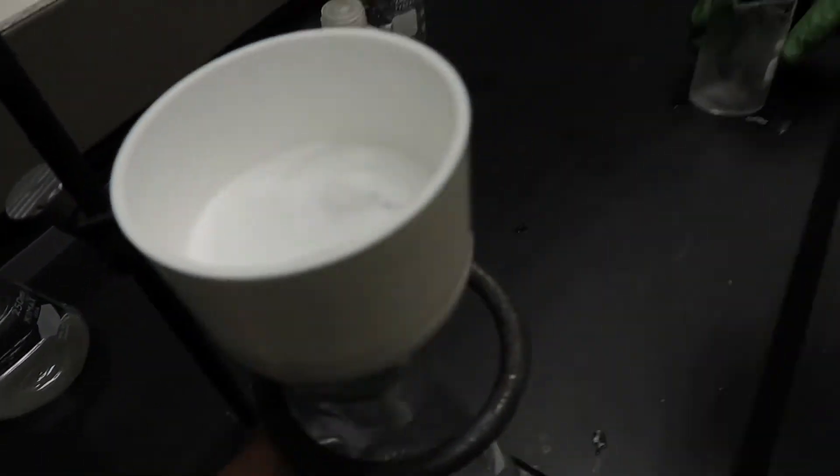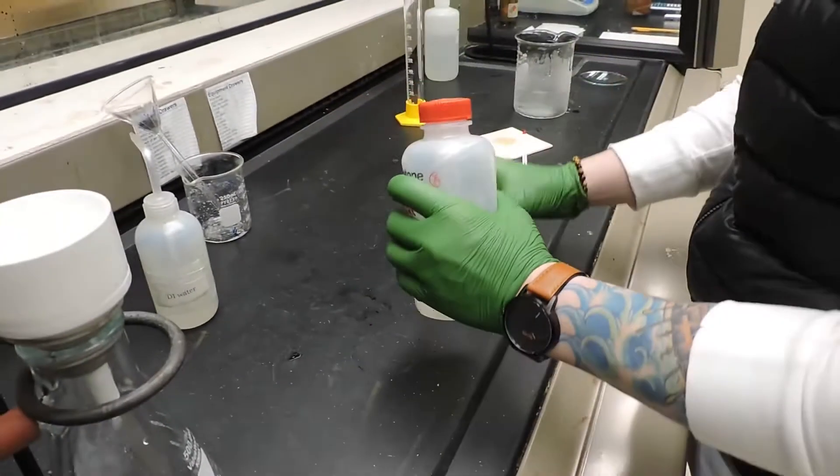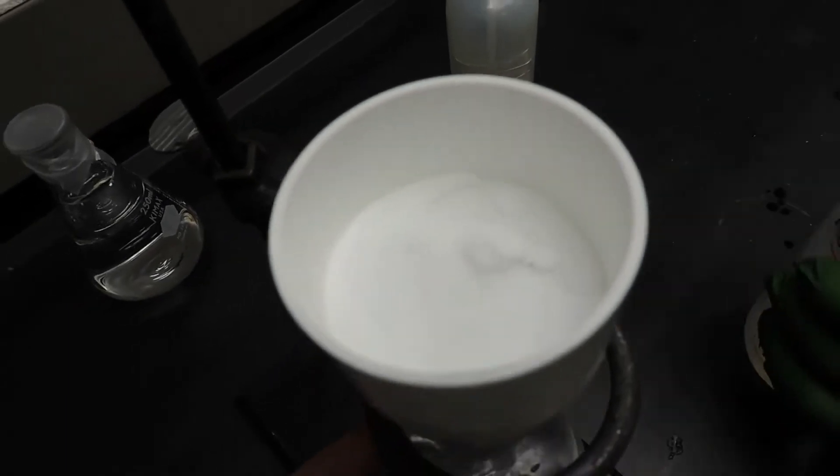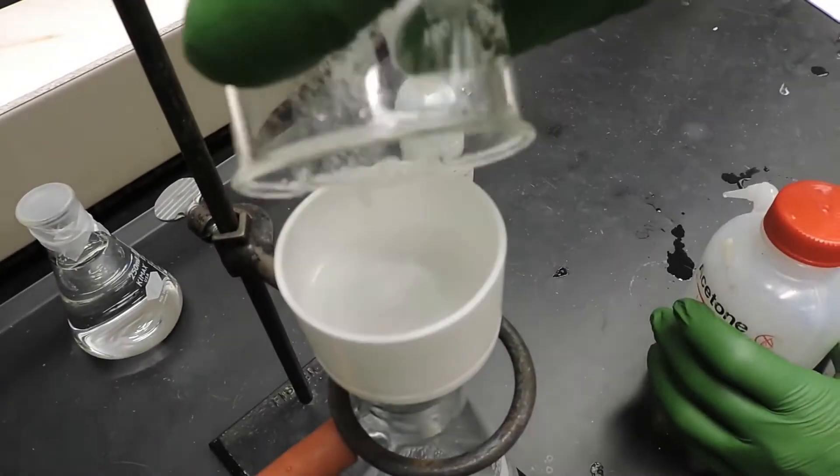Now we can rinse our crystals with acetone because we want to remove as much water as possible.